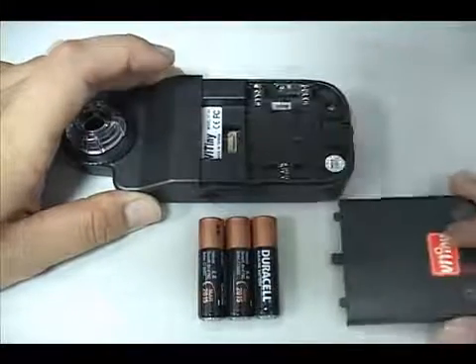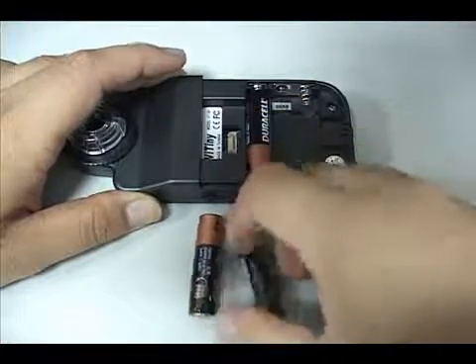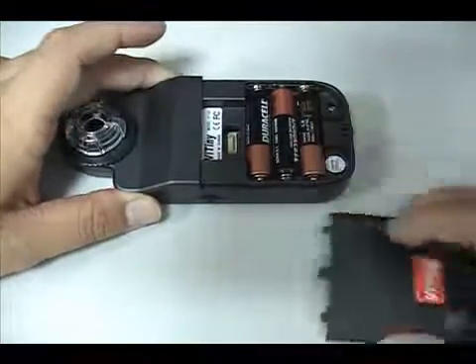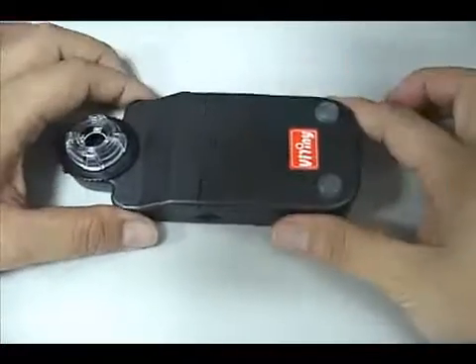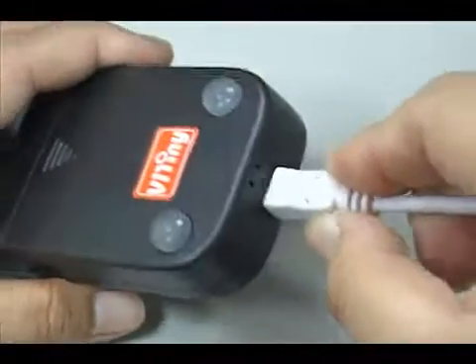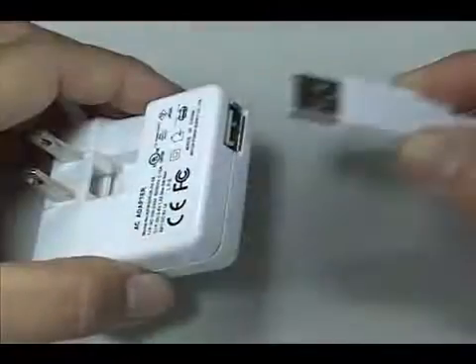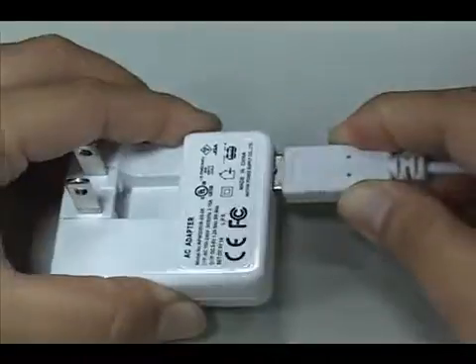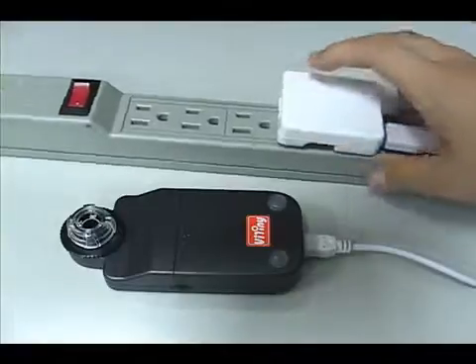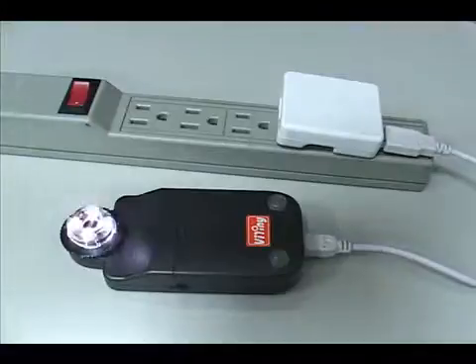There are three power supply options: battery supply, PC or Mac USB supply, and adapter supply. When you put batteries into the microscope and connect the USB cable and adapter, it can start charging by external power.